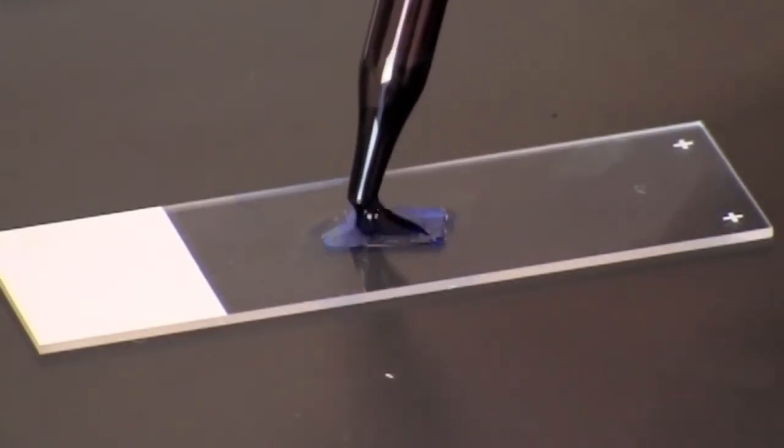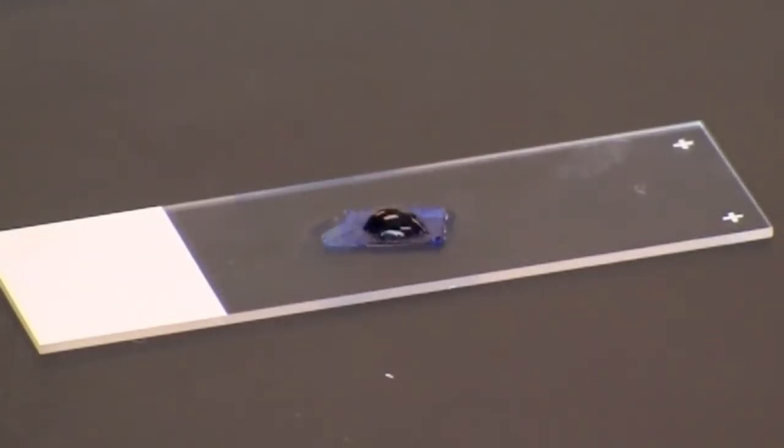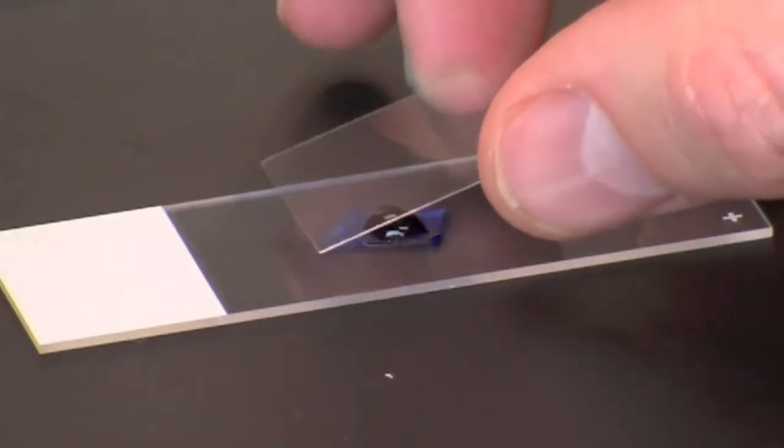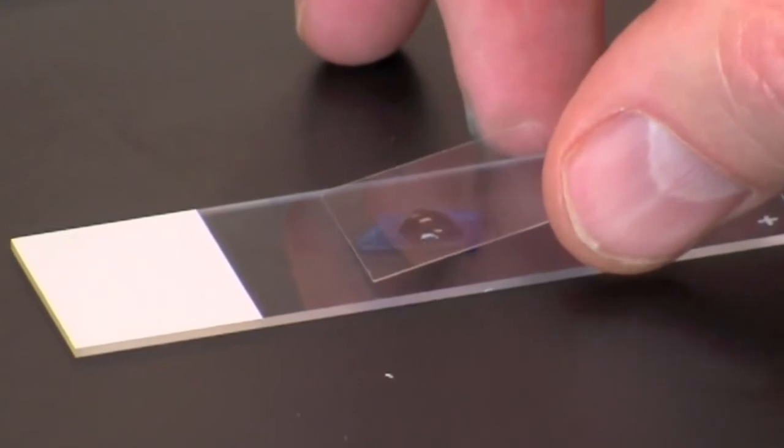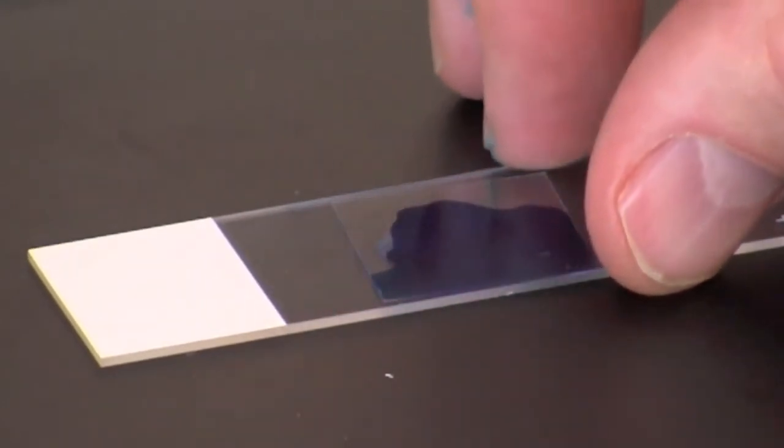Add another drop of fast blast DNA stain on top of the piece of onion. Prepare the wet mount by lowering a coverslip over the stain, starting at a 45 degree angle.